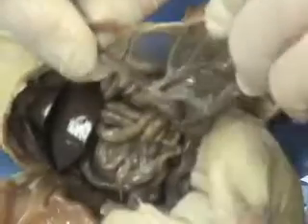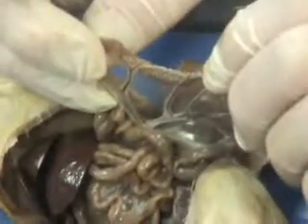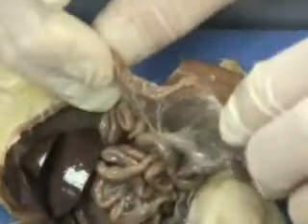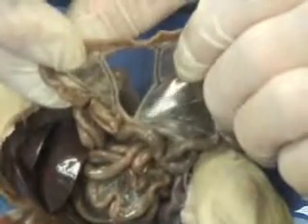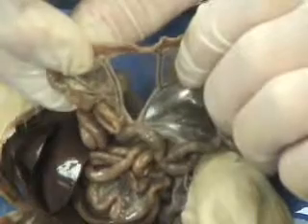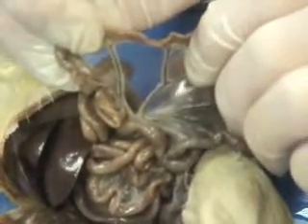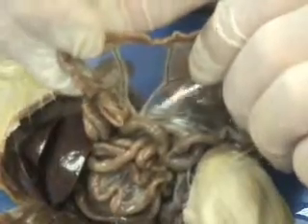As you're pulling apart all the intestines, you're going to find really clear material here. This clear material is called mesentery, and it's there to keep the intestines intact, keep them together versus getting into knots and spreading around the abdomen. In addition, in here you're going to find some arteries and veins. As the small intestine absorbs nutrients, those arteries and veins are going to bring the nutrients to the rest of the body, and these mesenteric arteries and veins are going to help in that process.